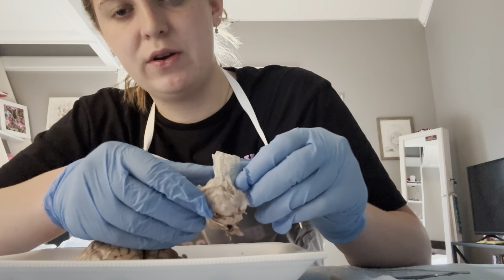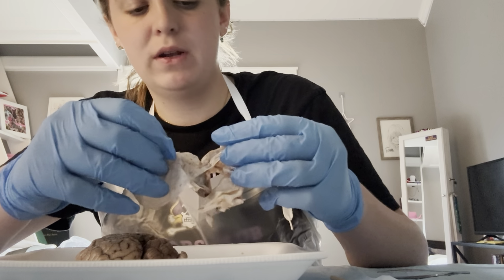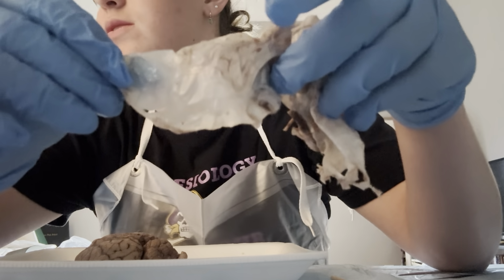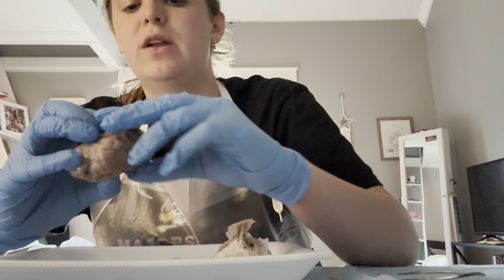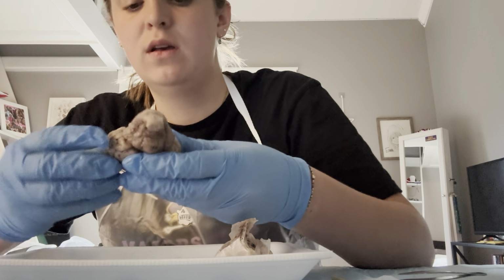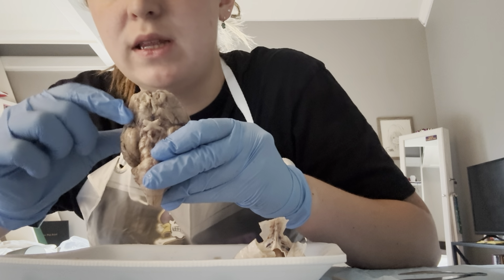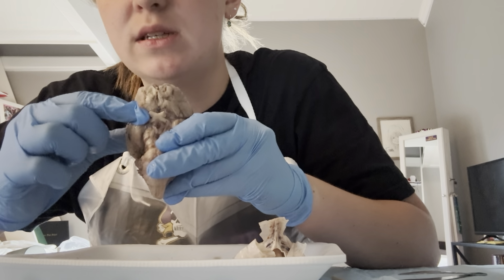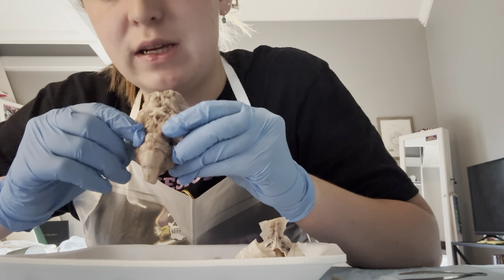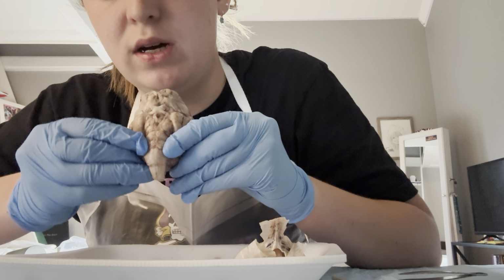This is the dura mater, and on the inside is the arachnoid mater. And then if you can see in here, there are blood vessels. And then the brain is separated into two hemispheres, separated by the longitudinal fissure. Starting at the top is the olfactory bulbs, and then we have the optic chiasm, this X. Down here is the pituitary gland. Here is the pons, and then down here is the medulla oblongata.